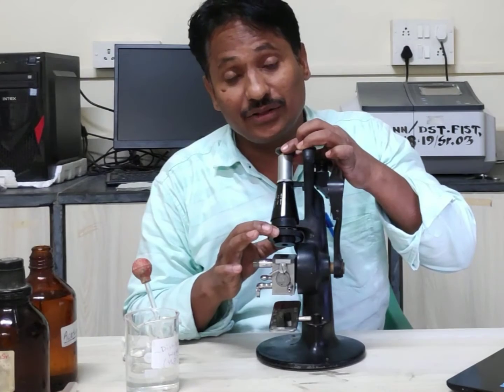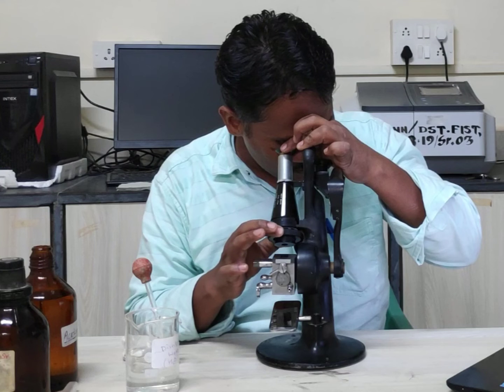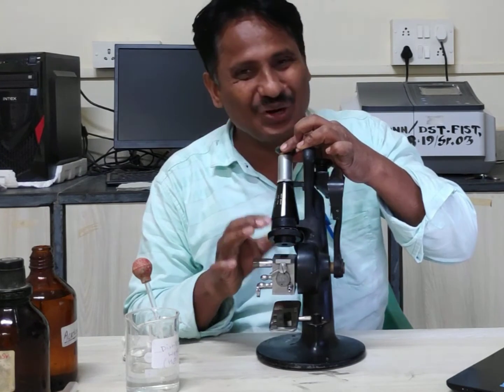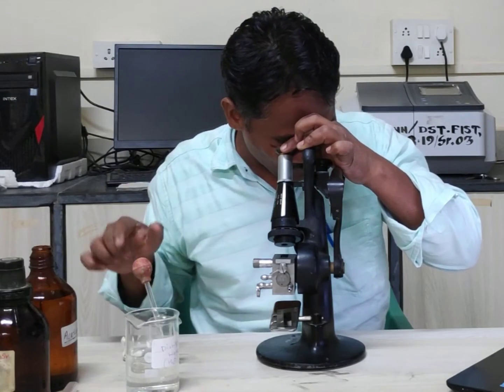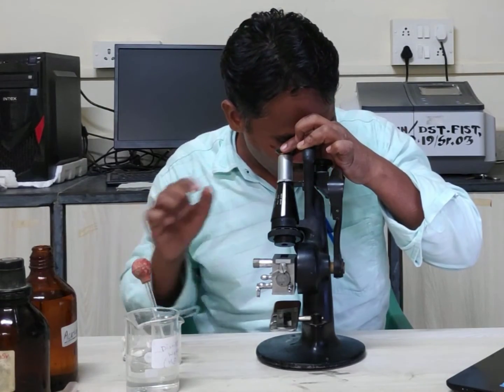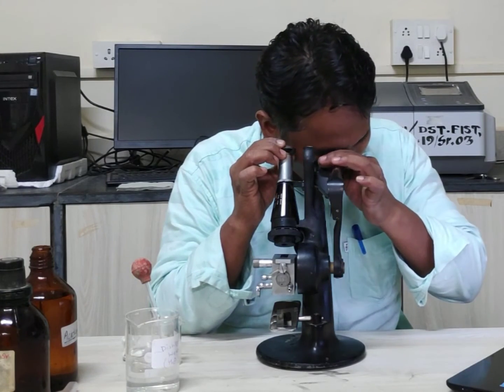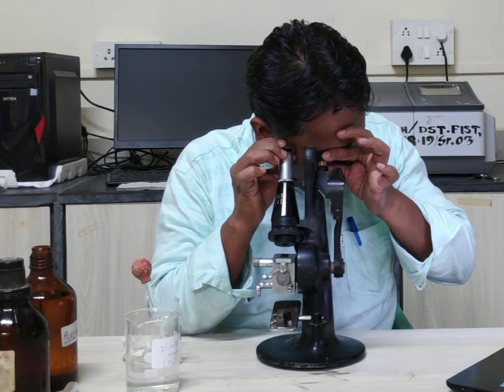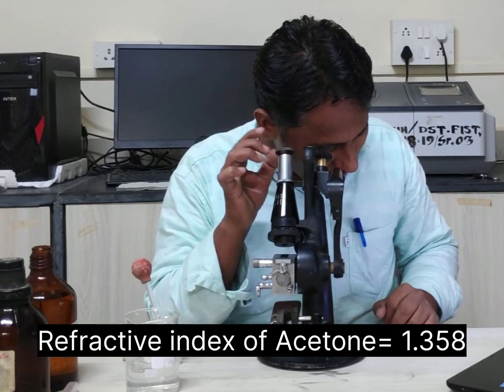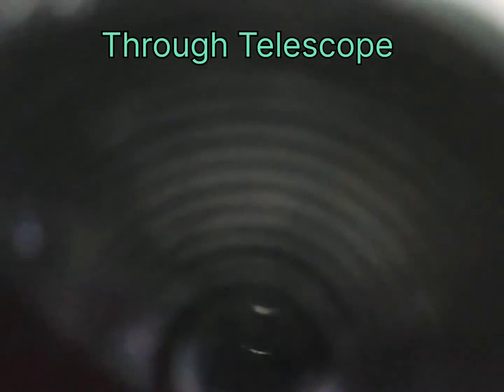Now put the sample in this area. We are going to adjust half dark and half bright. We got it. Now see the scale — the refractive index of acetone is 1.358.